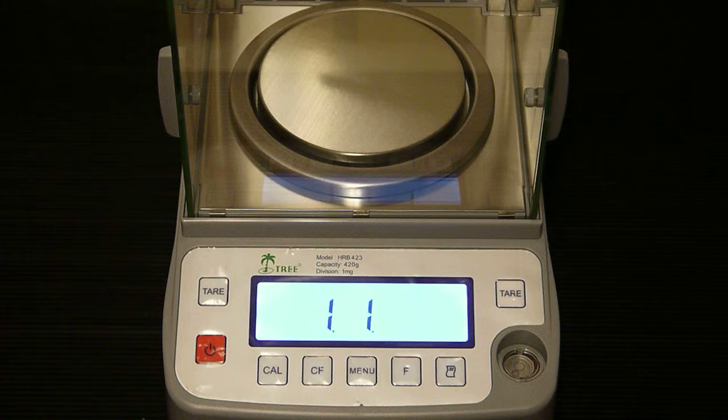Now we want to use the menu key to increase the value of that digit. Again our menu code is 174, so we want to press the menu key until we get to 7.